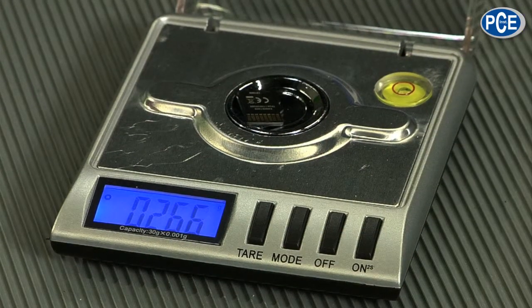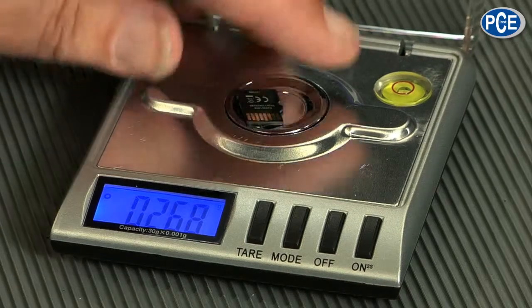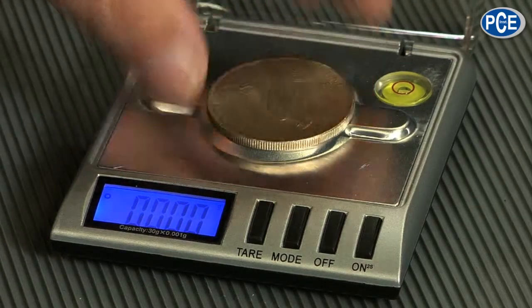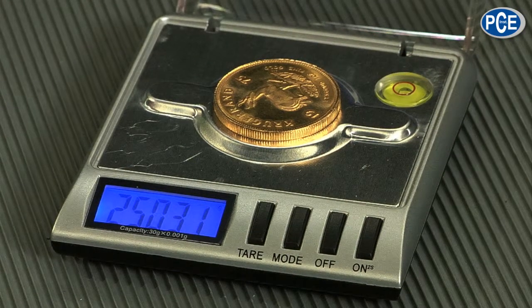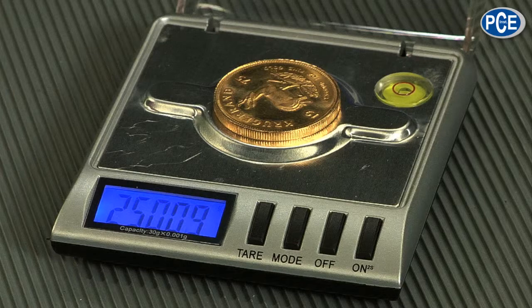It can only weigh a maximum of up to 30 grams, but with a very big resolution. For example, I can take a memory card and lay it on it - as you can see, it weighs 0.267 grams. Or I lay a silver dollar from 1923 that my granddad brought back from the States - it weighs 19.76 grams. Or something very noble, a Krugerrand - let's see what that weighs: 25.0 and so forth. So as you can see, I can determine very fine weights with this.